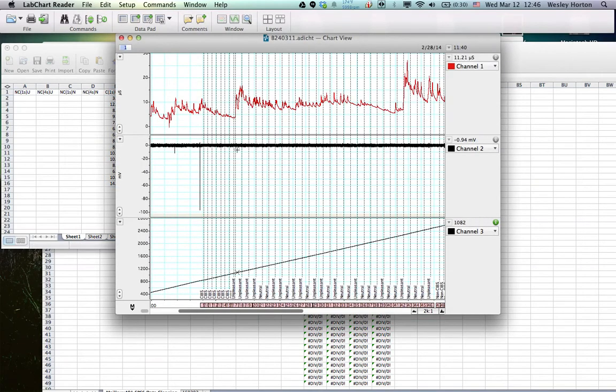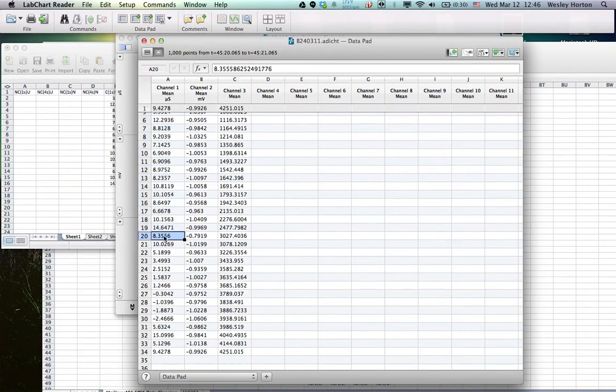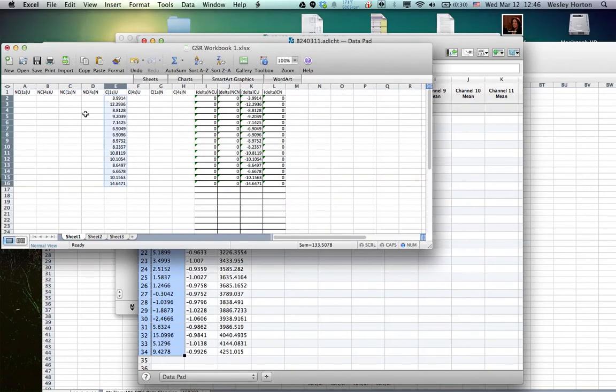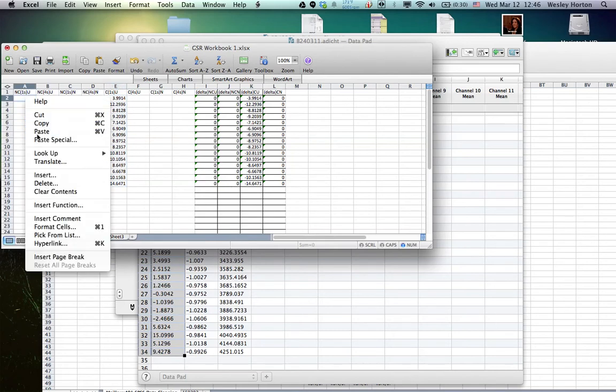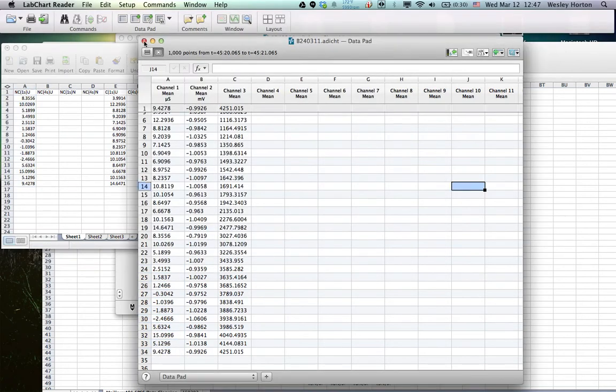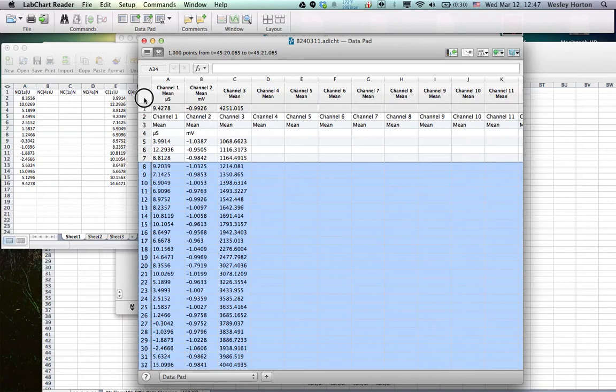Now we're going to go back to the data pad, grab the next 15. 1, 2, 3, 4, 5, 6, 8, 9, 10, 11, 12, 13, 14, 15. So that's going, this section is going to go into the non-sibs, unpleasant 1 second before. All right. So we can go ahead and delete all this data. We've already pulled it out.